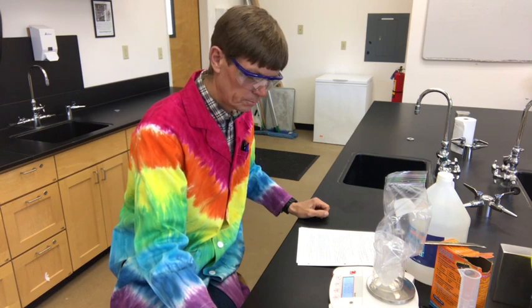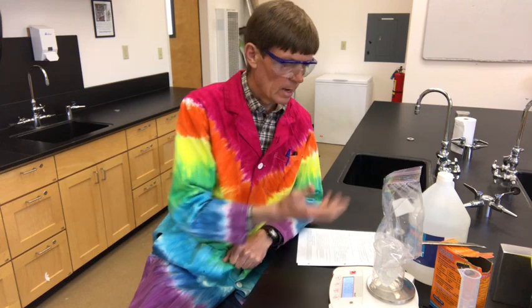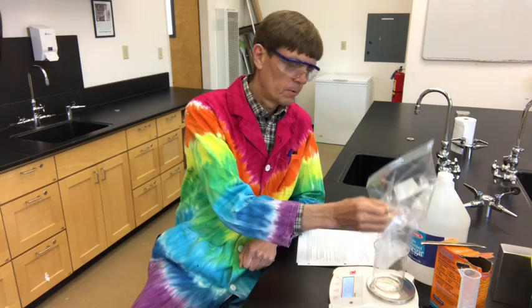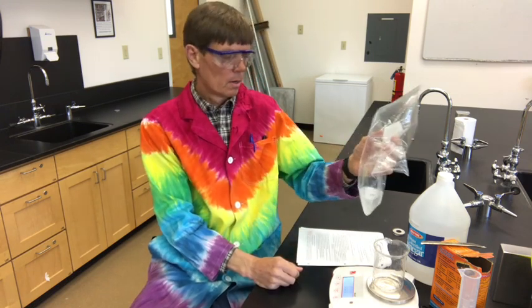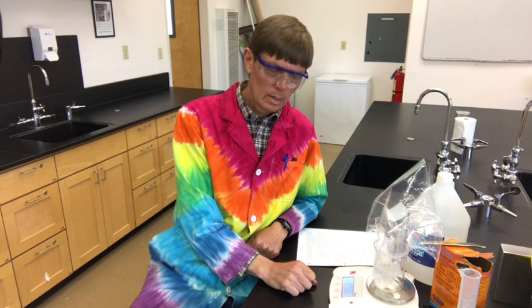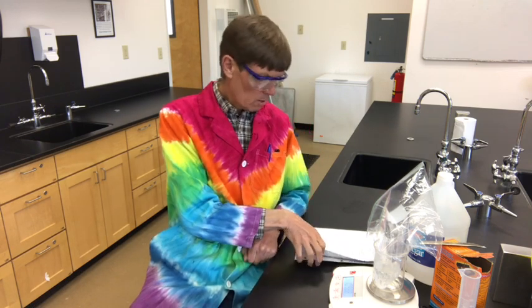well, before I tell you, do you expect it to be the same mass, different mass? Is it going to be lighter, heavier? Well, we trapped all the carbon dioxide. That's what filled this bag with gas. So we kept all the mass in here. We didn't let it get away from us like we did in the first part. So you'd think that it should be the same mass, but the scale tells us that the mass is 109.88 grams.